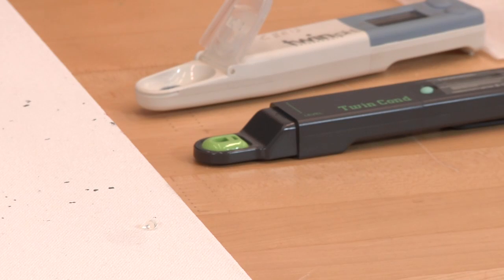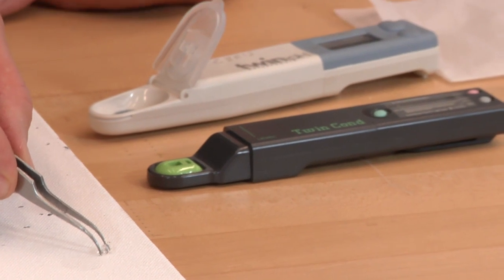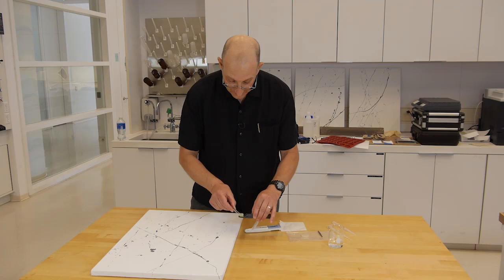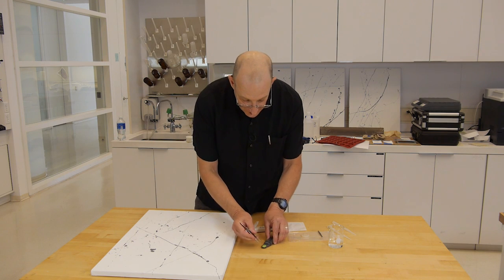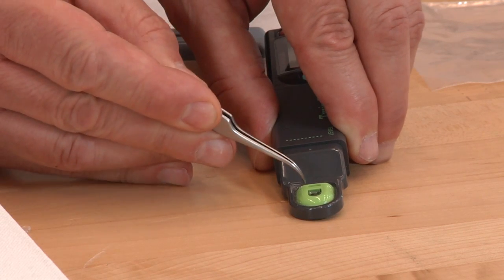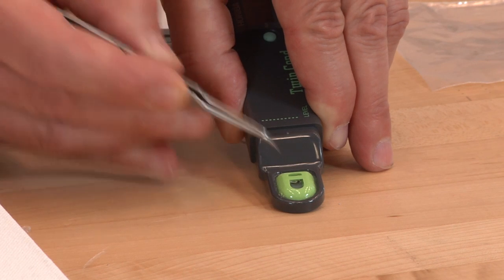So it's been about two minutes. We pick up our plug. And you notice there is no residue or wet spot on the surface. We push the plug into the conductivity meter so that it is contacting both of the measurement electrodes in the conductivity meter, the two little black squares.